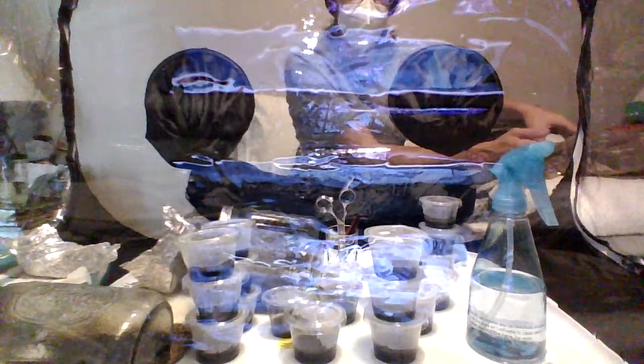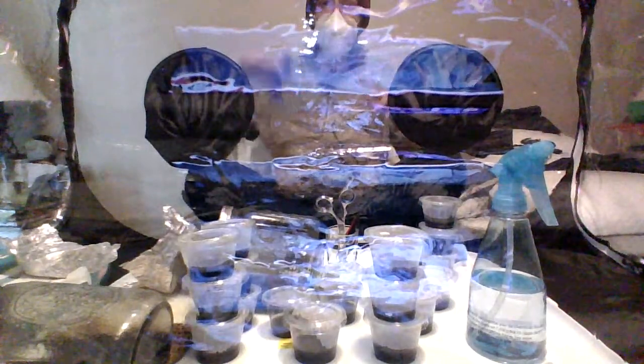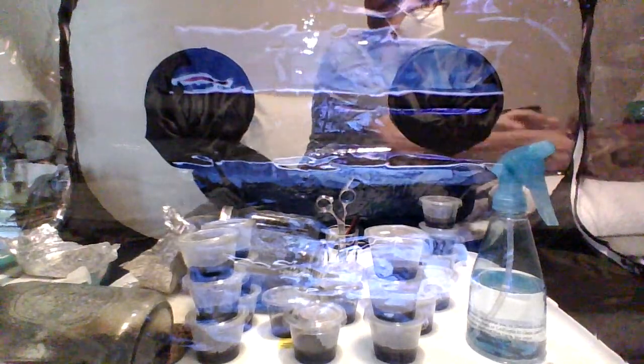But I had these, and I got them from a dumpster, so I consider that low budget DIY, you know what I mean? They were still in the package unopened. I'm going to use them. Once I open my gloves, I keep them in a grocery bag, keep the dust off of them. Just kind of makes sense. You always want to follow your proper protocol when doing stuff like this.